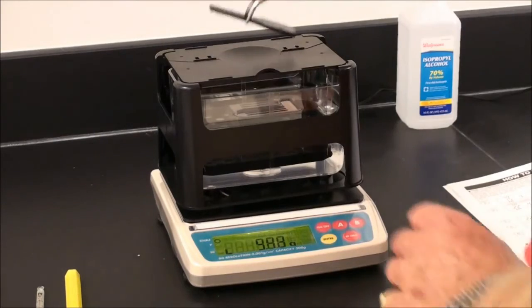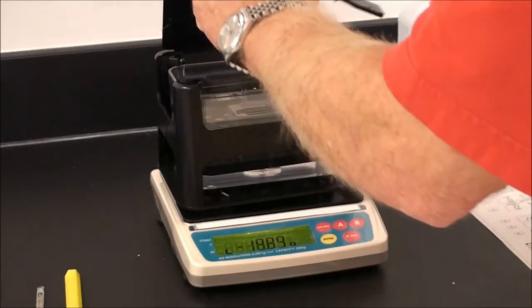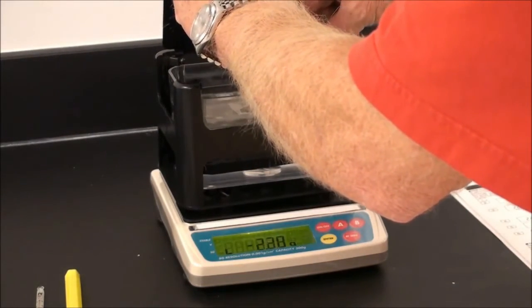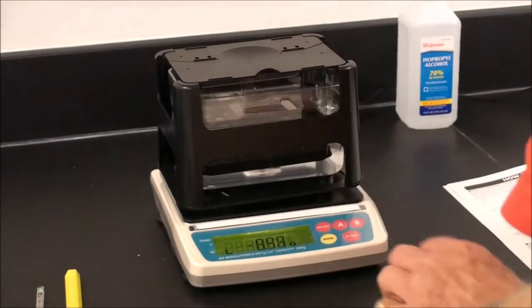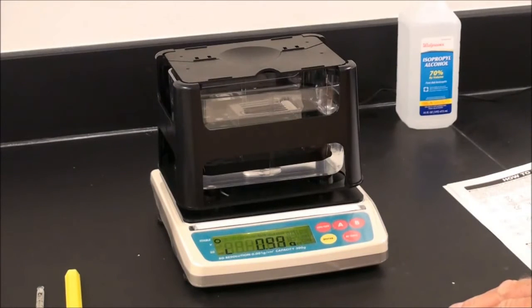Remove the sample, open, and place in the water. If the sample sinks, the density is greater than one, and it is not necessary to use the steel weighing angle. If the sample is less than one and floats, it'll be necessary to put the steel angle on top of the sample to keep it submerged.